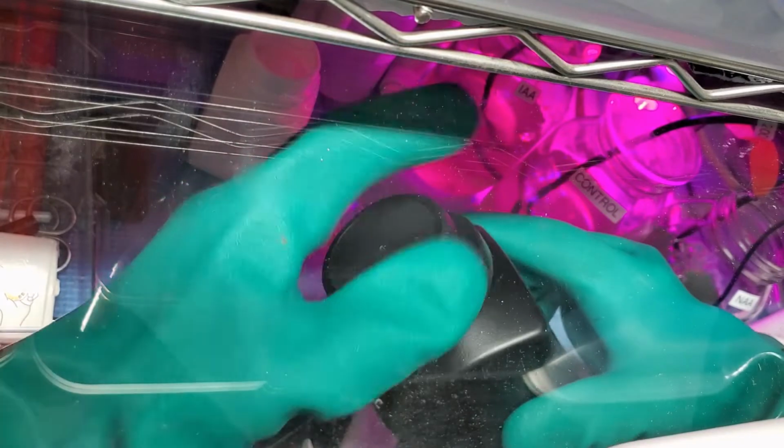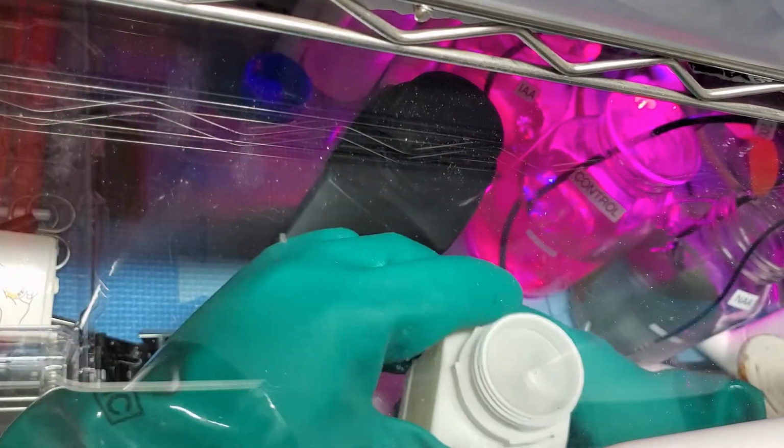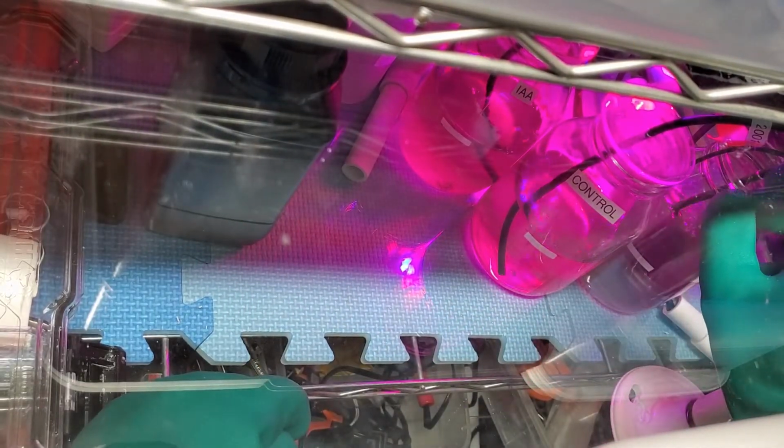And now the first measurement I'll take will be actually 24 hours, and then I'll be doing measurements every 4 days for 60 days. And pretty much that's it for now. I'll check in again in 24 hours with this.